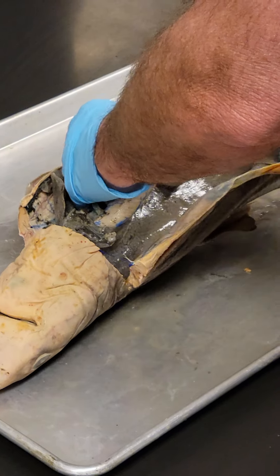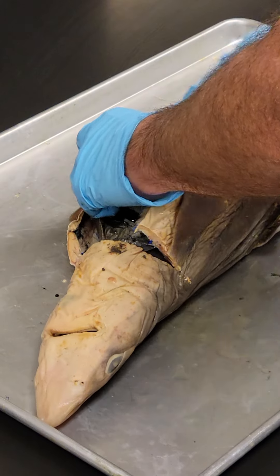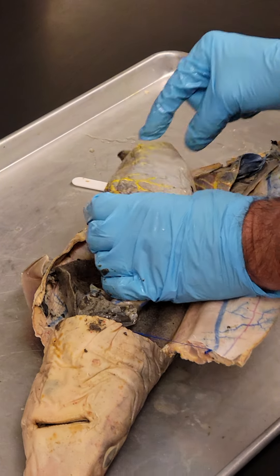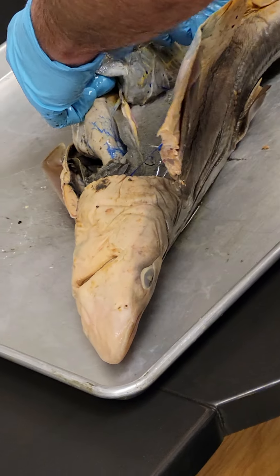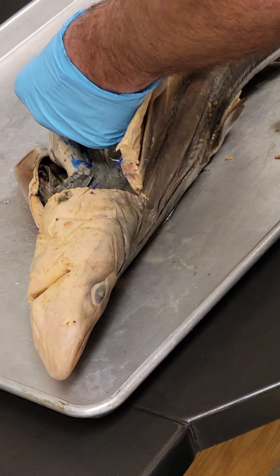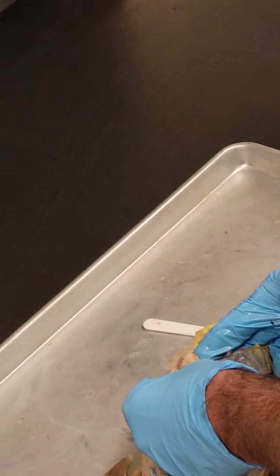The intestine — let's go from the front. This is the stomach. I can tell it's been eating something. This is the cardiac portion of the stomach — I don't know why they call it cardiac stomach, but it's probably because it's a muscular area. Then this is the pyloric region, and then the duodenum there. This is the pancreas right here — it's a glandular organ, not really a discrete organ. I think of it like bubble gum stuck to your chair or shoe.